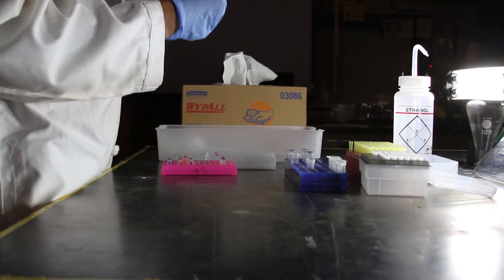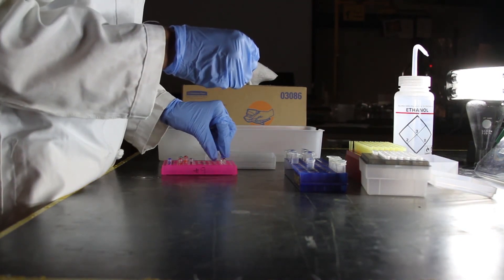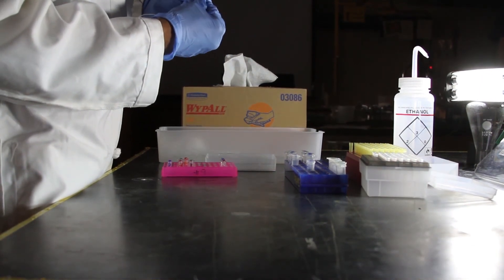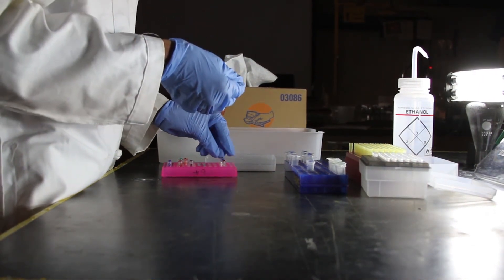We use a thermocycler, but a water bath and an accurate thermometer works well also. The digested DNA can be stored at 4 degrees Celsius for a few days. For longer storage, you can keep it at negative 20 degrees Celsius.